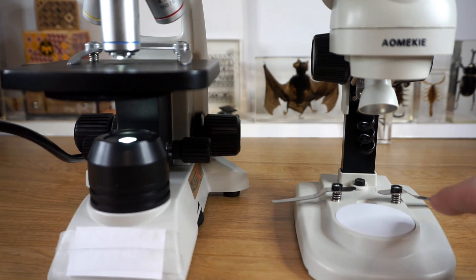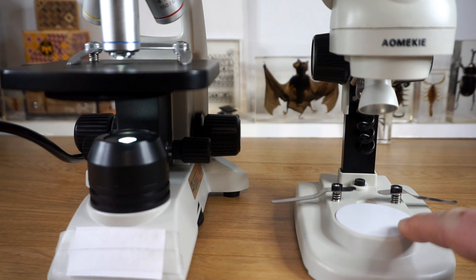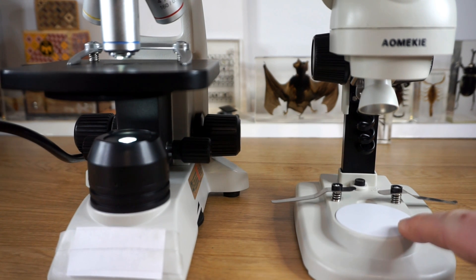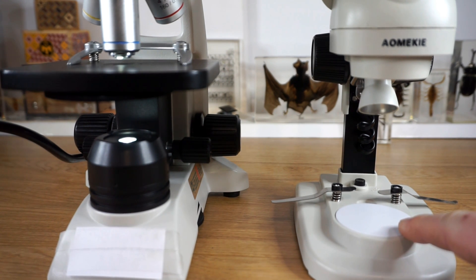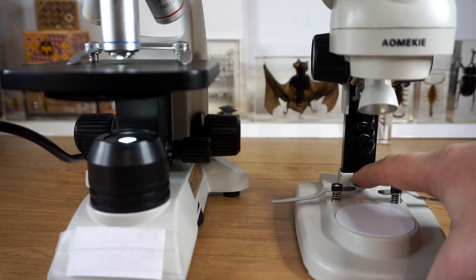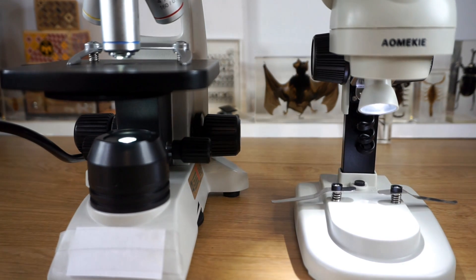Whereas with a stereo microscope, you can often still see the object without an additional light. But in this case, we do have a lamp that makes it a lot easier to see.